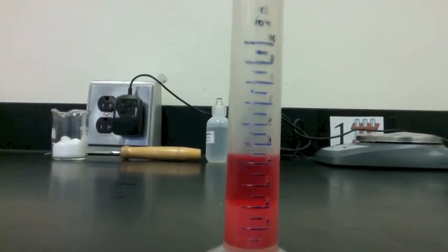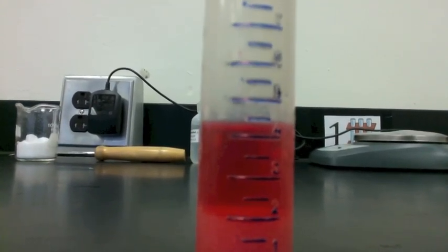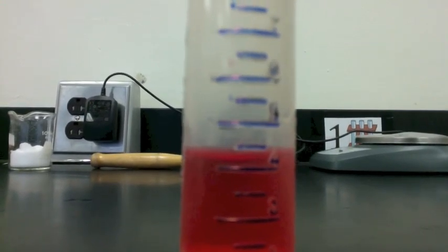The graduated cylinder on a level surface and getting eye level, we can see that the second volume, the lowest point of the meniscus, is at 4 milliliters.